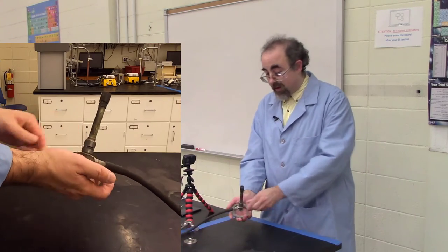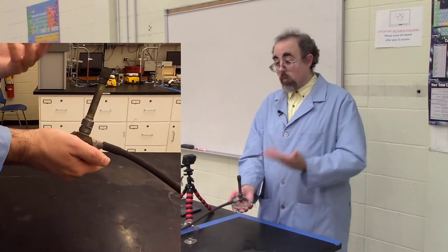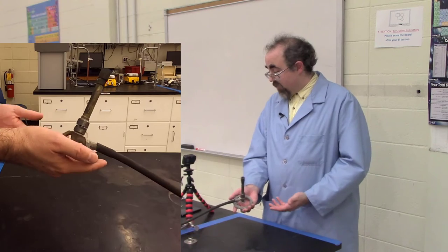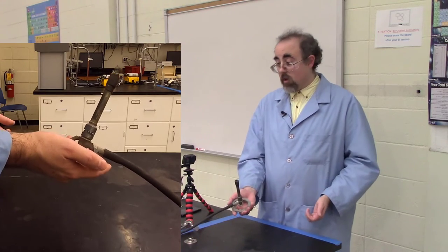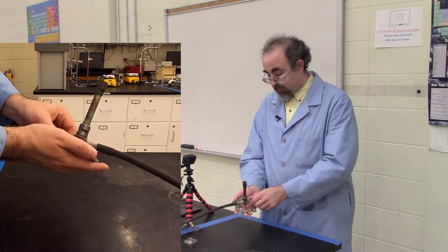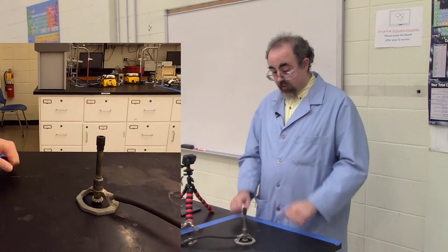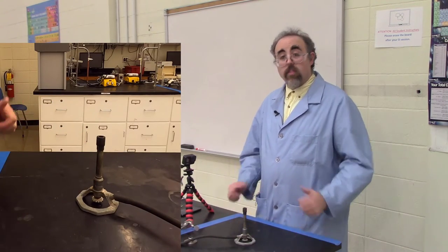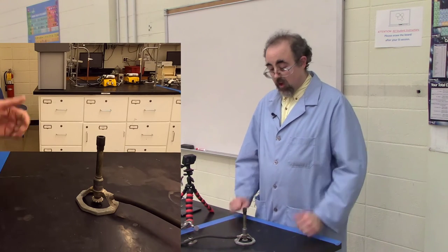You will also notice there are some techniques where you literally hold the Bunsen burner while it is active from the bottom. In this case, you are literally using it as a blowtorch, because that's basically what this is, a blowtorch. So we've got ourselves our Bunsen burner, and in the rest of this video, I will talk more about the flame and how to light this critter.